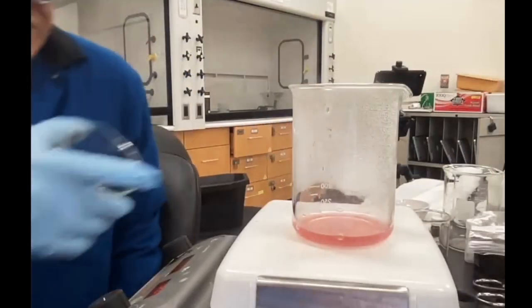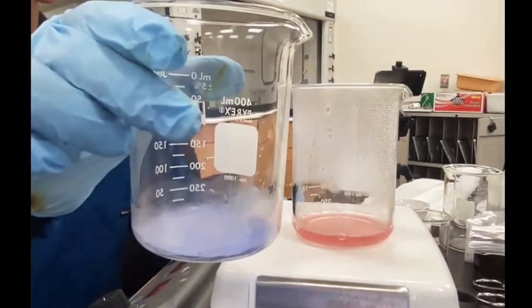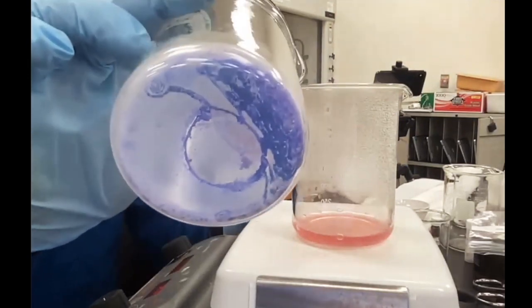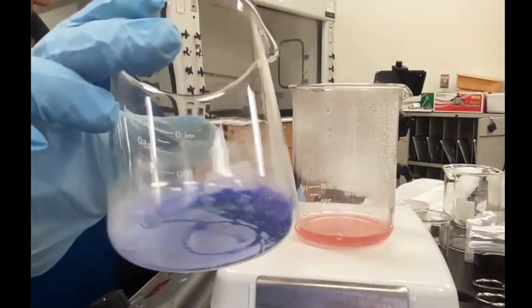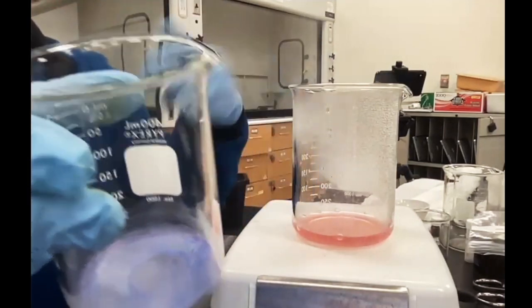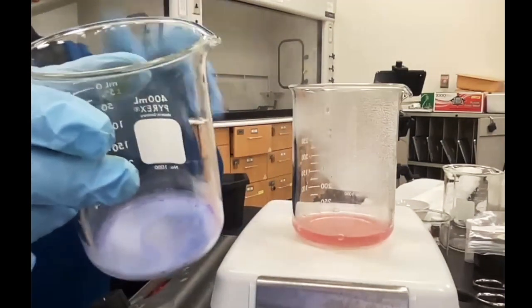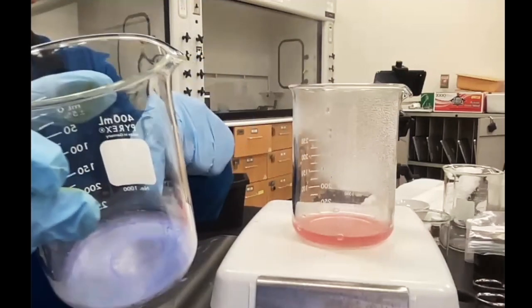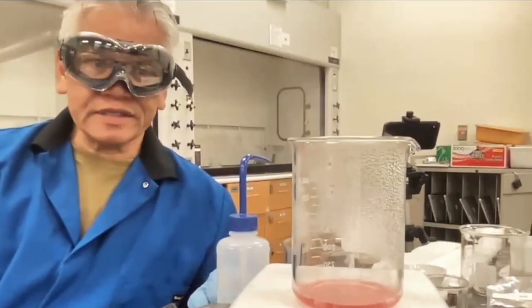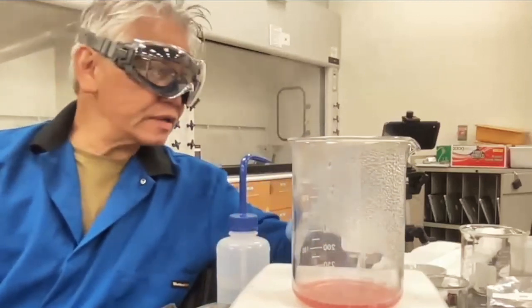So when this thing starts to go down, and you'll see that shortly, this is what it'll turn into. Okay, this is what it turns into. And the very last step is we're going to put a drop of water just to see what it looks like when it is rehydrated, because this is in the dehydrated form. Dehydrated just means it doesn't have the water in it. And then when we hydrate it, you're going to see again some physical characteristics. In the meantime, like I said, this right here is the bottleneck of your experiment, the longest procedure.